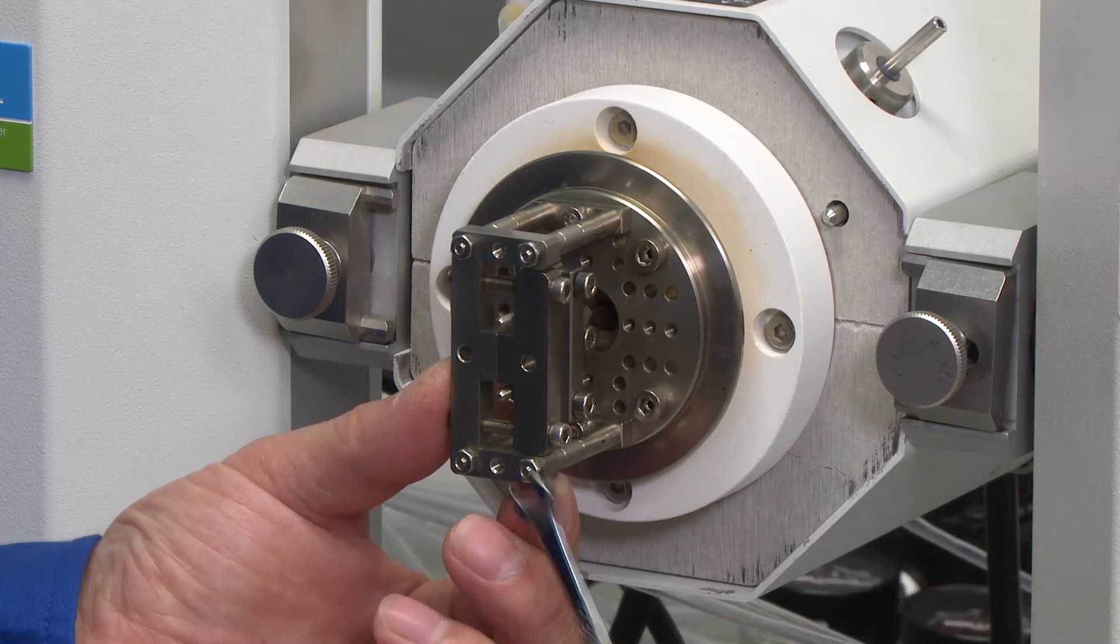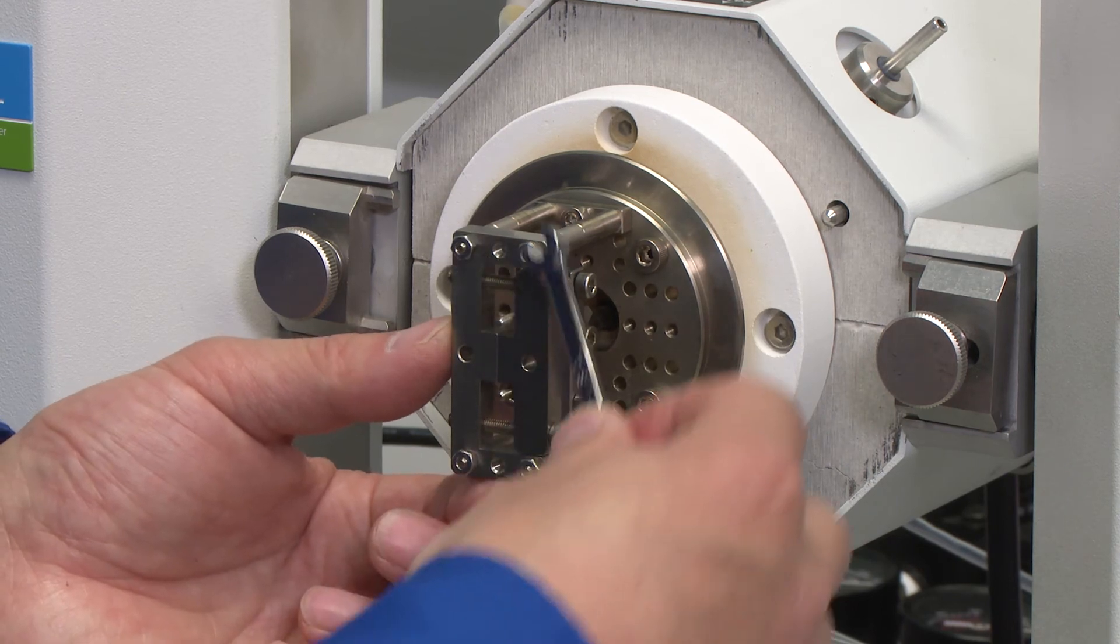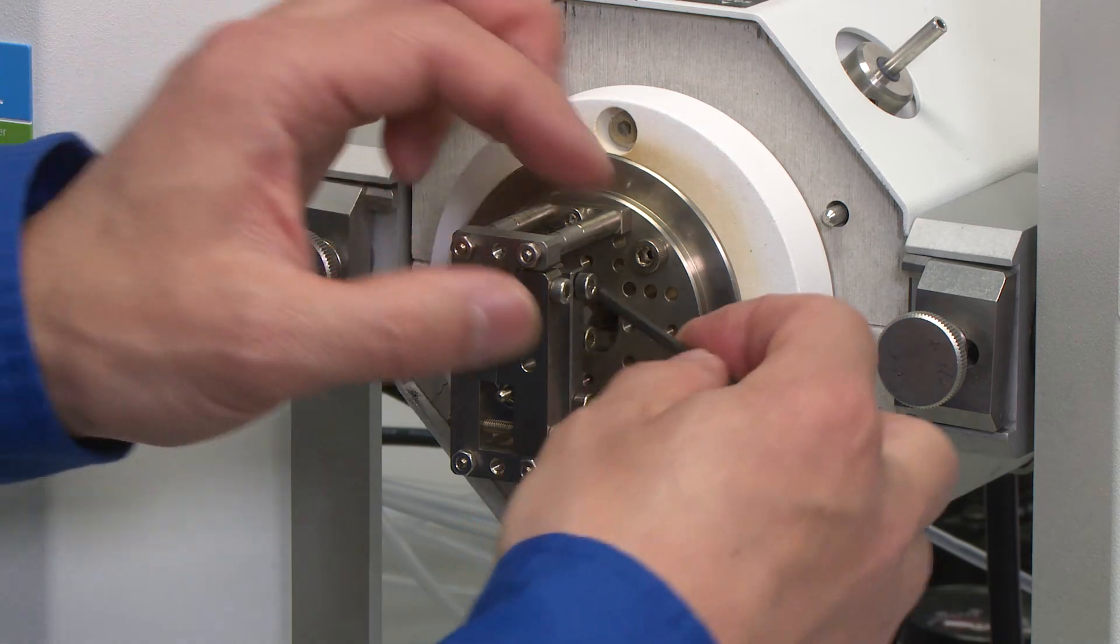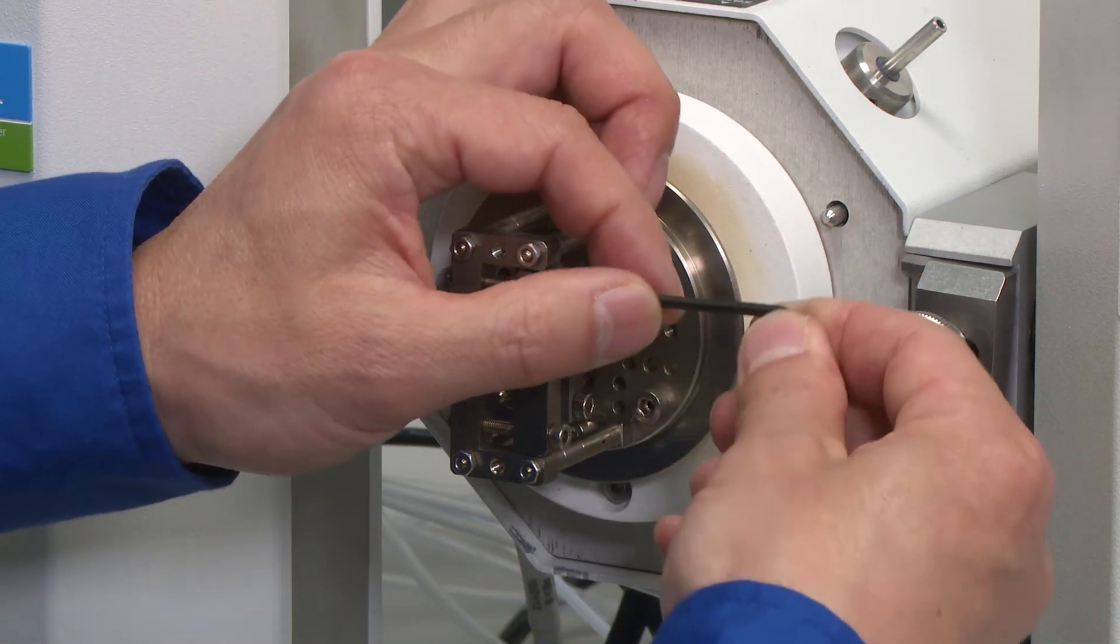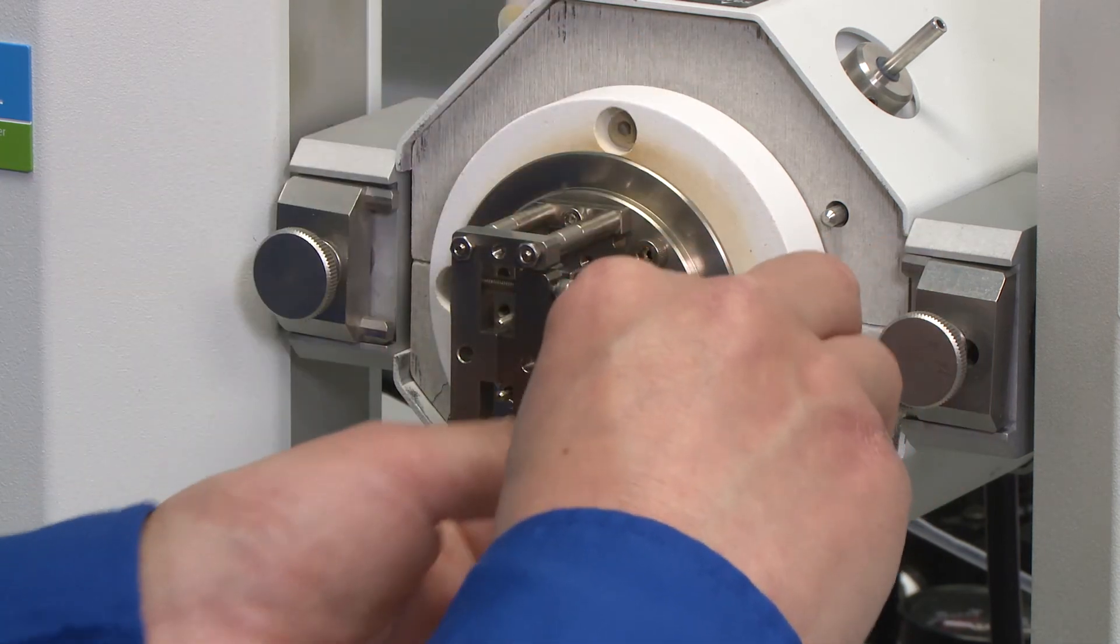Once the outer plate or clamp is securely placed on the fixed pillars, we can loosen these two nuts so we can load the sample.